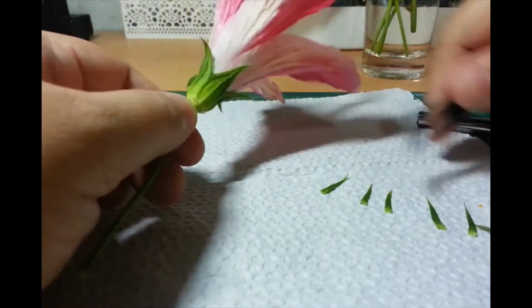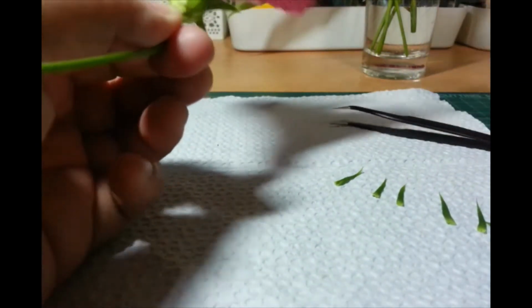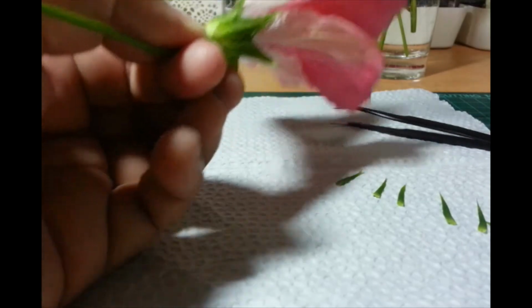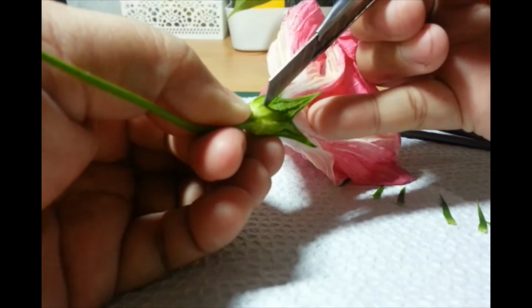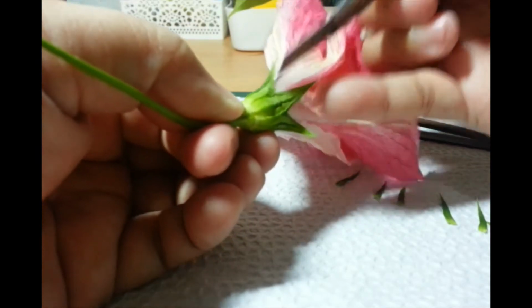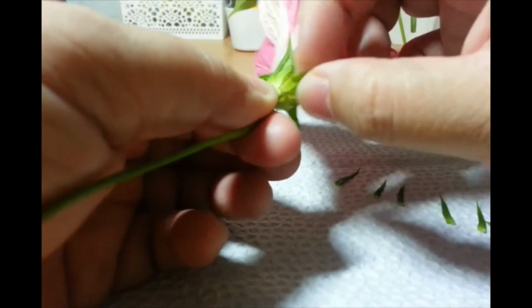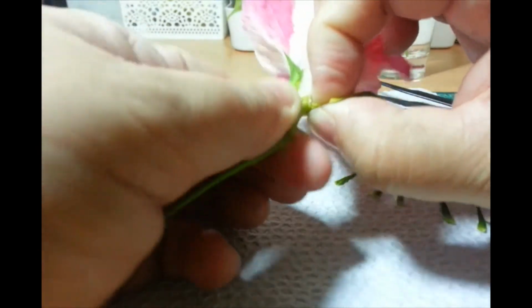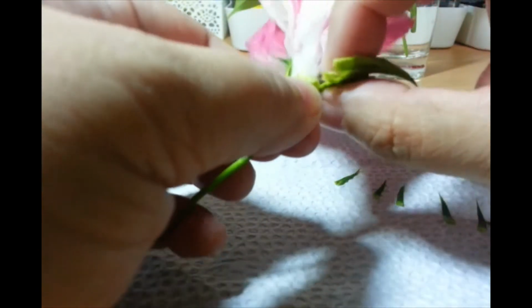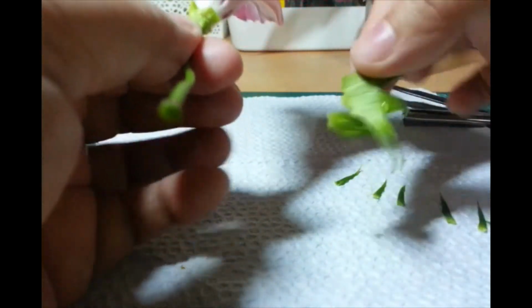Okay, so I've removed the bracts. And then I'm going to remove the sepals very carefully. Okay. I'm not very good at editing, so baka isang pasada na lang to. I hope I don't cut too deep. Okay. Yan. So, itong sepal kaya kong ma-remove in a ring. May tira-tira sa dulo. Okay. There.